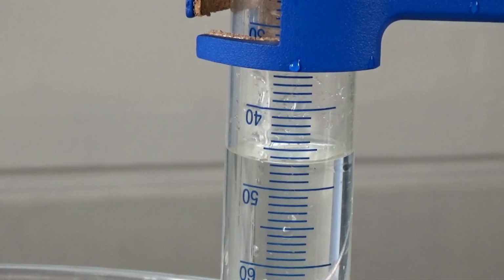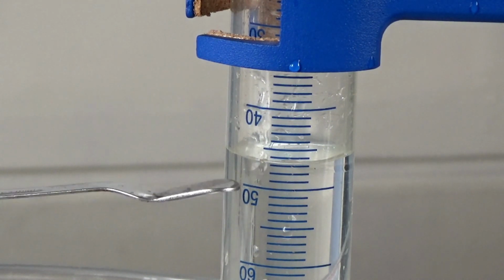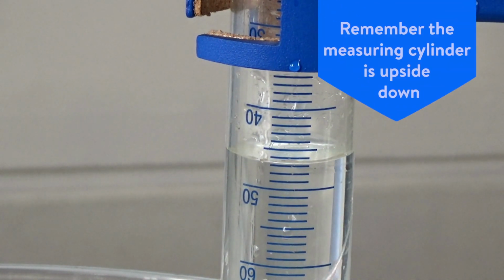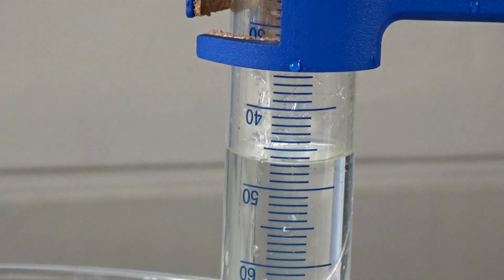It's worth pointing out to your students how to read off the volume of gas produced from the measuring cylinder. So a common mistake is, in this case, they would see 50 and count up from 50. So they'd go 51, 52, 53. But of course, the thing they've forgotten is the measuring cylinder is upside down. So they need to count from 40. So it would be 40, 45, 46, 47. And this is actually a common exam question, and every year a surprising number of students get it wrong.